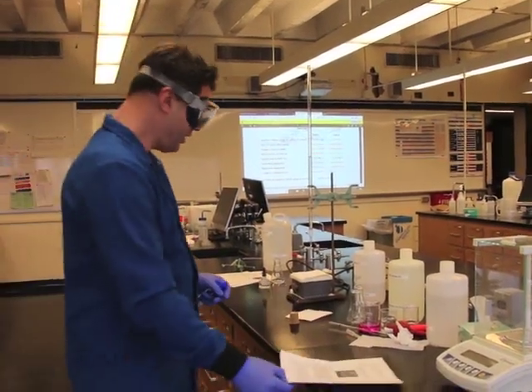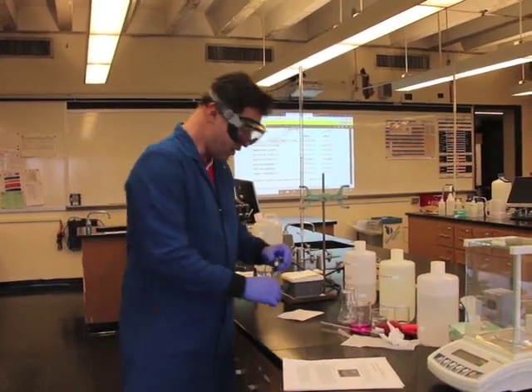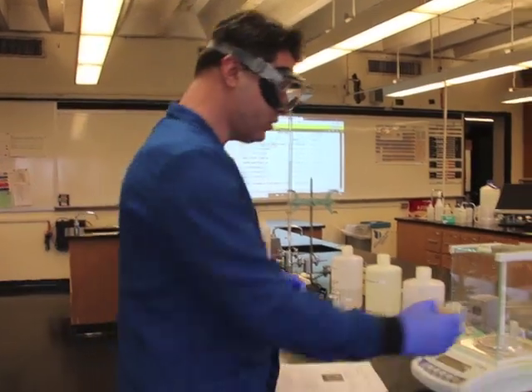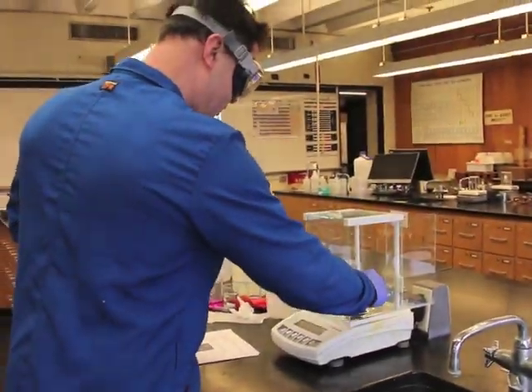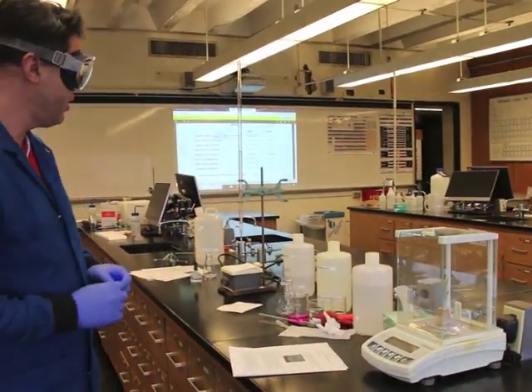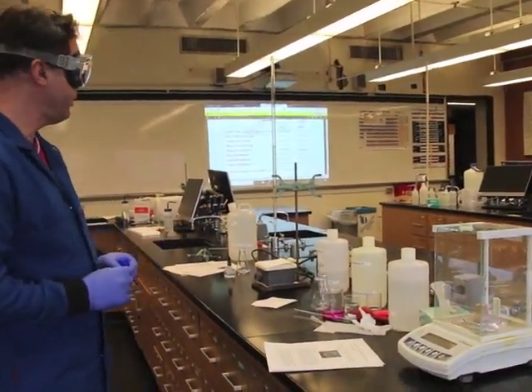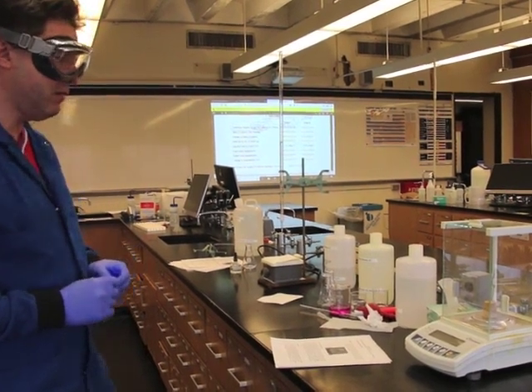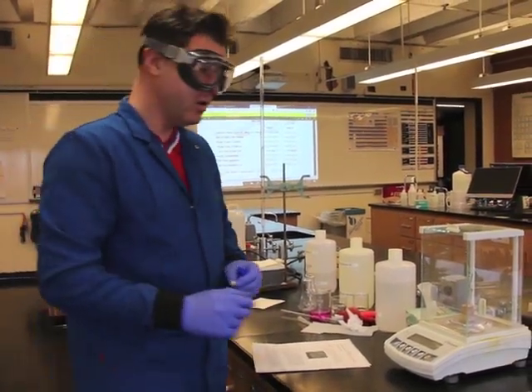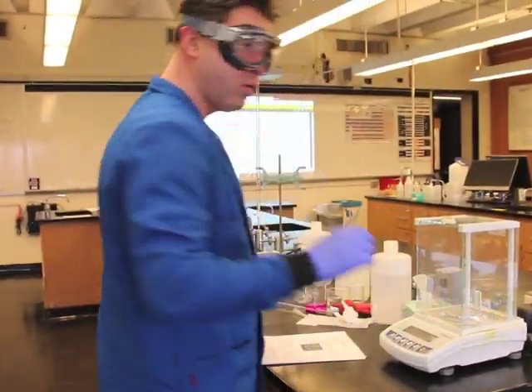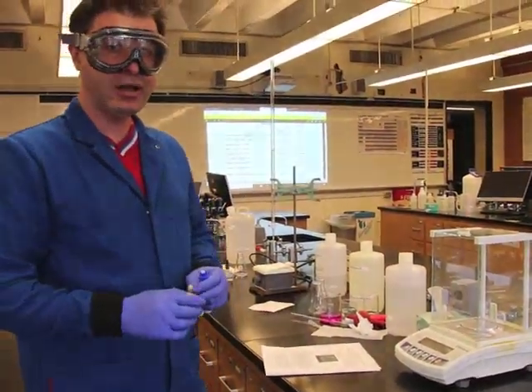My first step is I need to determine the mass of my cashew nut holder. I'm going to place it now on the balance which was already zeroed. The mass of my assembly is 4.9356 grams. Just document it because we're going to come to that mass in a moment.